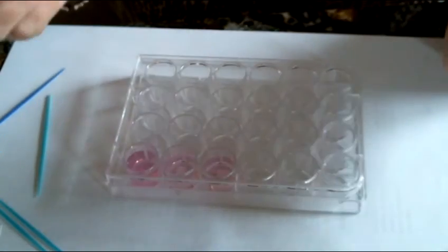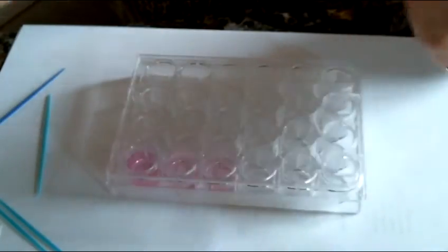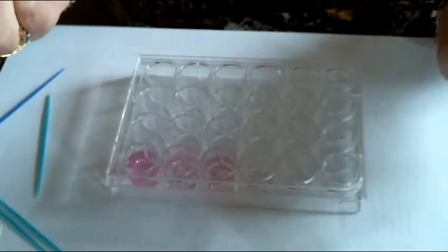You want to be very careful that you know exactly how many drops it took to get there. And now we have all the data we need to calculate the molarity and the percent acid in our vinegar. So after cleaning everything up, we'll meet again in our classroom.